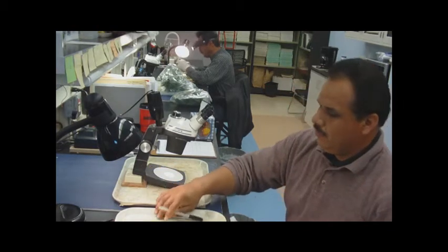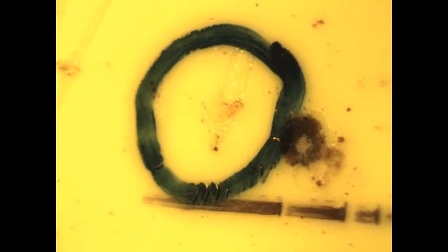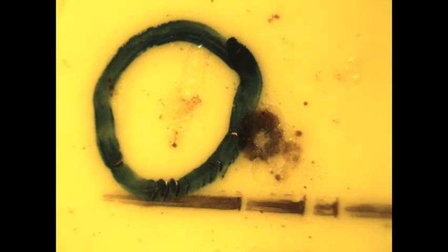All right. Thanks, Leo. Well, to finish with the laboratory part of this sampling method, we're here looking in the microscope at Western flower thrips larvae. And Gerardo right here is in the microscope. What are you seeing right there?